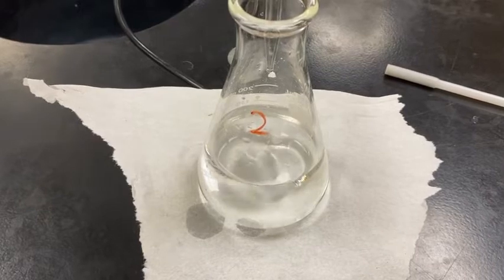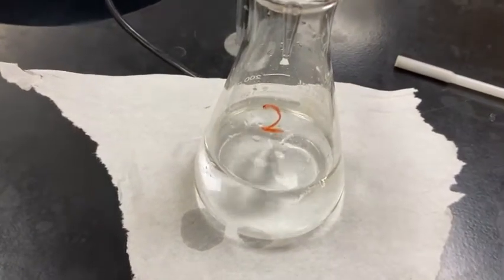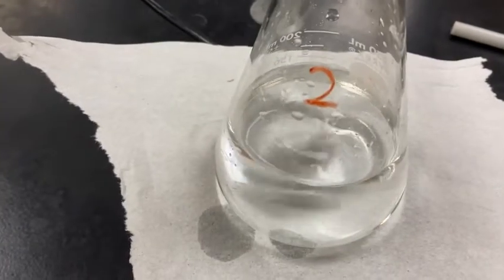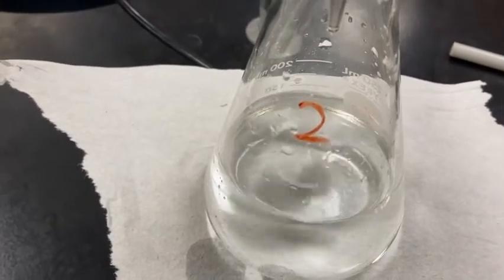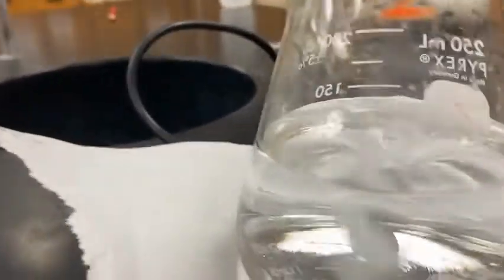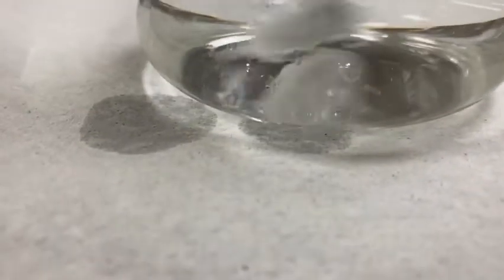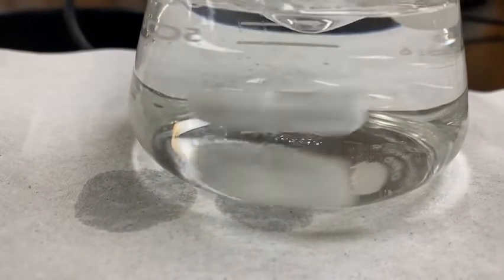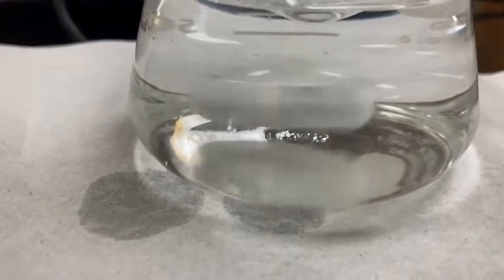Now we just repeat that whole process over again with our second trial. So I've got the new KHP flask, trial 2, underneath the burette. I've got the added water to it. I've added the stir bar. KHP looks pretty fully dissolved. There's a little bit of pieces, but I think it'll be okay as we titrate.